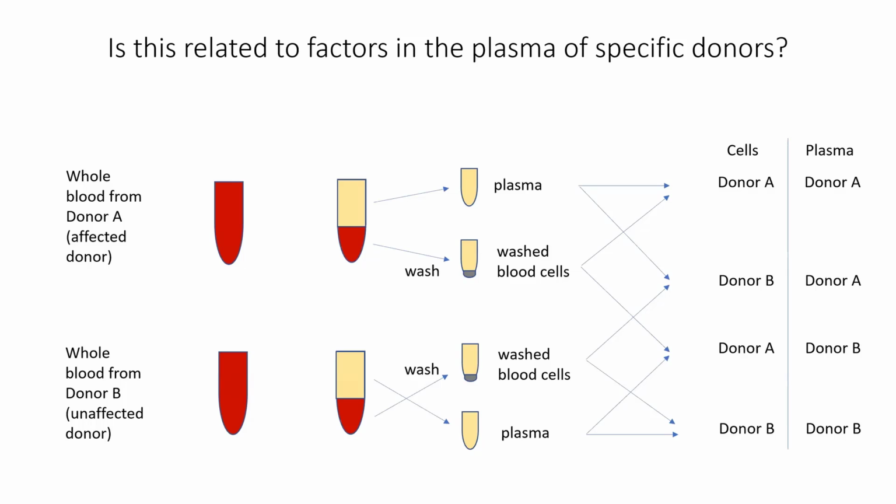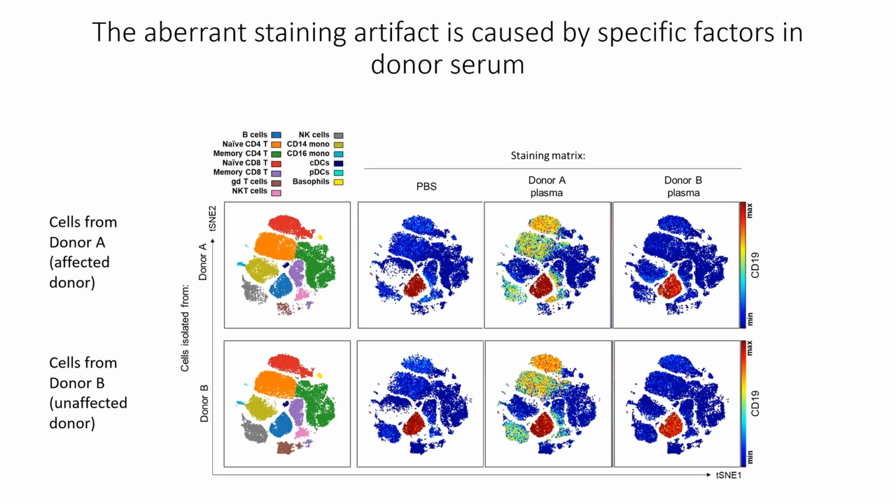And in doing that experiment, this is what the data looks like, and it's pretty clear. The top row here is showing blood cells from the affected individual. The bottom row is showing blood cells from an unaffected individual, and the different columns are showing different staining matrices. So you can see if you take those blood cells and stain them just in the presence of PBS, the artifact is completely gone. The CD19 staining here is now localized just to the B cell compartment, as you would expect.